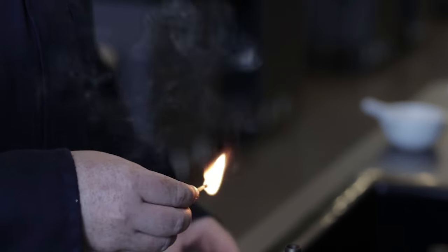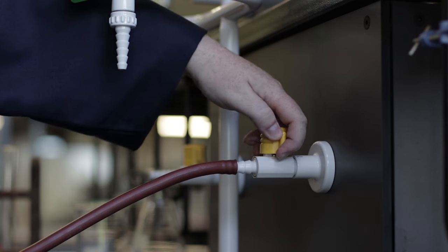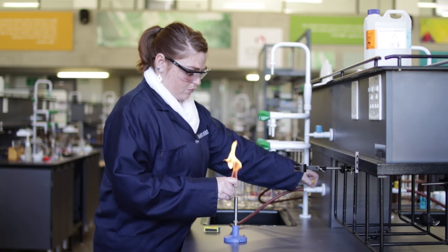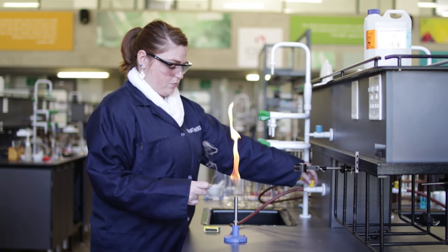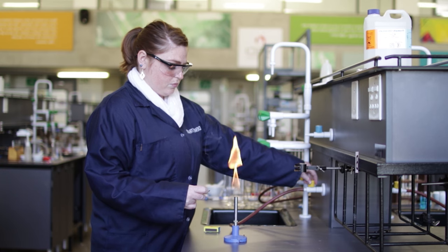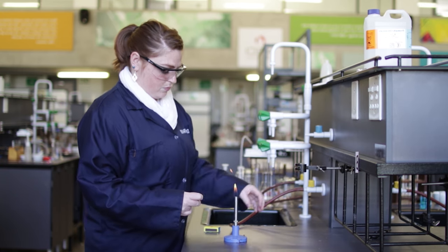This process will be vice versa if the Bunsen burner and the gas tap are the other way around. The gas will then ignite and an orange-yellow flame will form. This flame is called a luminous flame and it is due to the air supply being closed off.